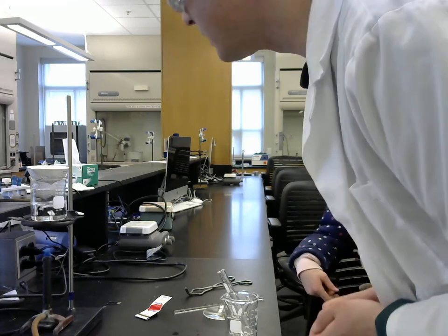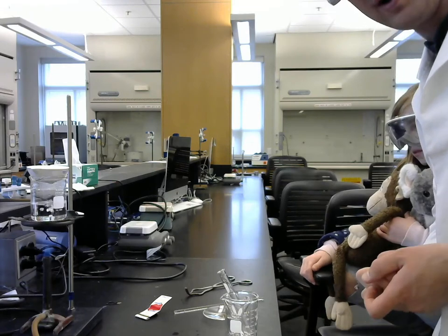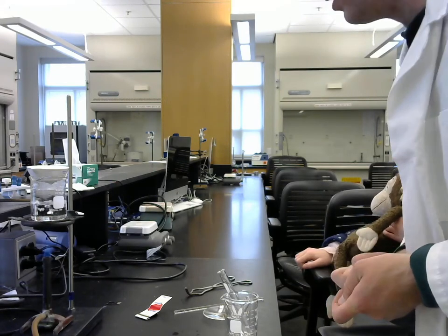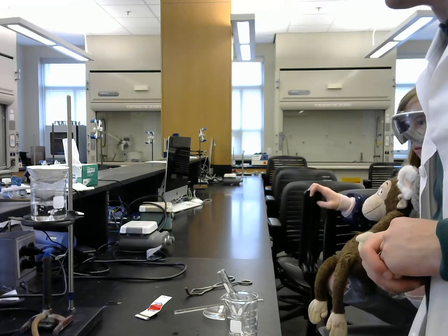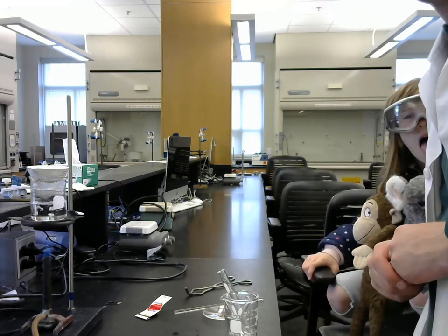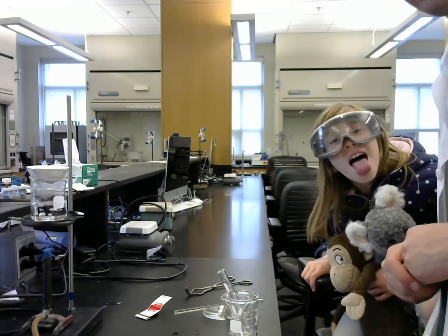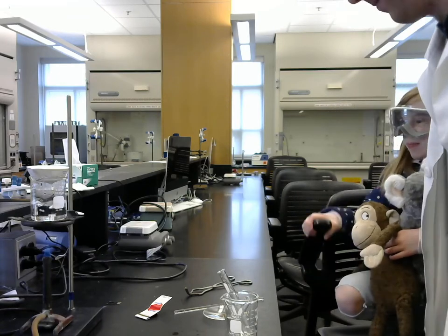This is going to take some time, but because we have the boiling water already heated up, it won't be that long. What we'll do is just leave this here and use some time acceleration in the editing to make it fast for you. And we'll see what's in the evaporating dish after all of the water solvent has boiled away.